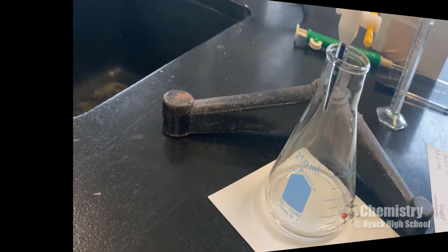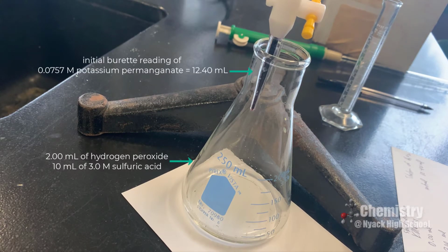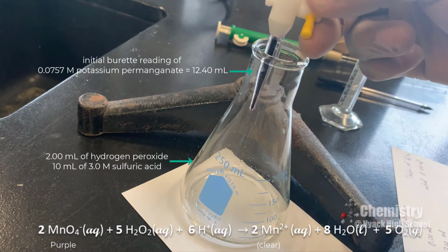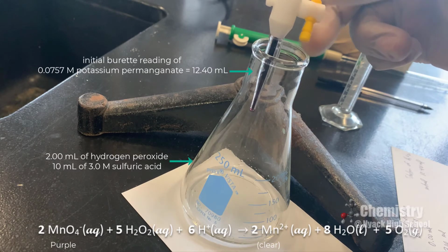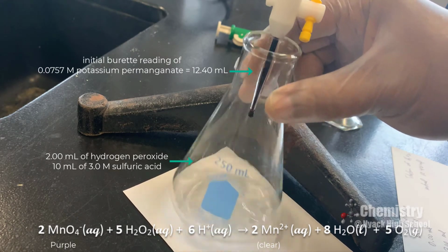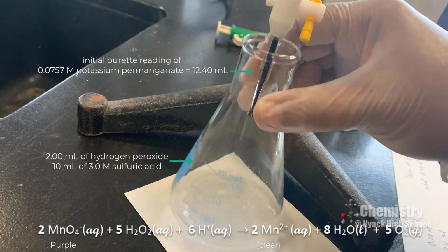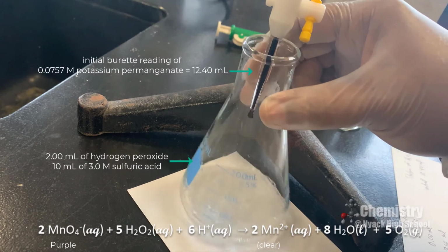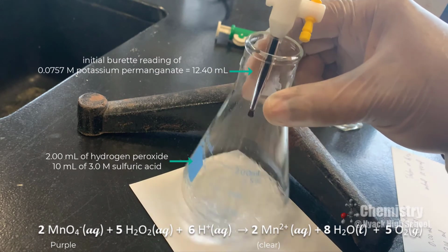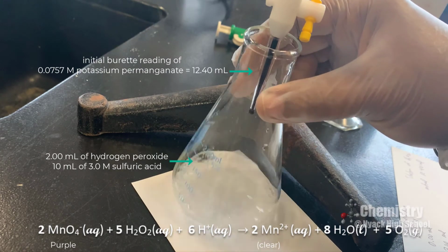Okay, so at this point I've added 2 milliliters of the hydrogen peroxide solution to 10 milliliters of the 3 molar sulfuric acid. I've read the initial burette reading at 12.40 ml, and at this point I'm going to titrate my solution until the faint appearance of pink as before. Note that the color appears and then it fades as before. When it seems to persist a little bit longer, I will slow down my titration.